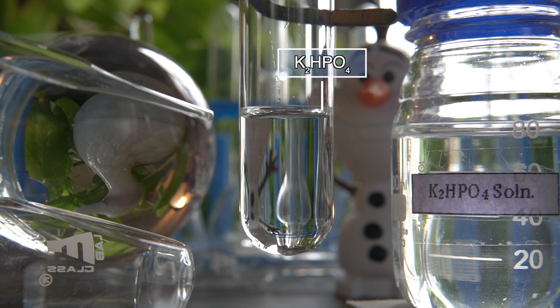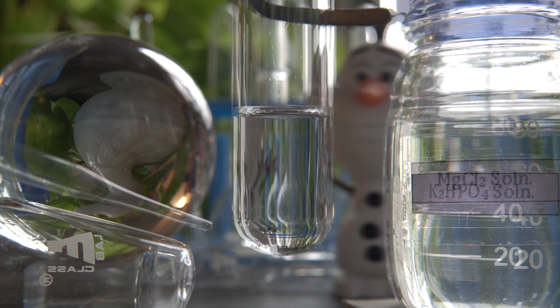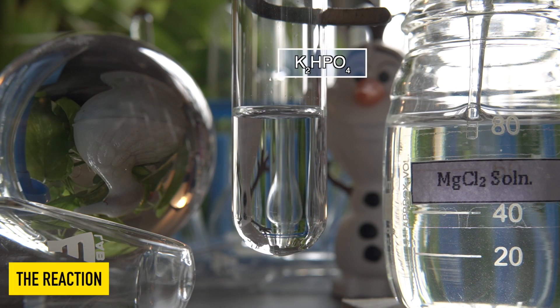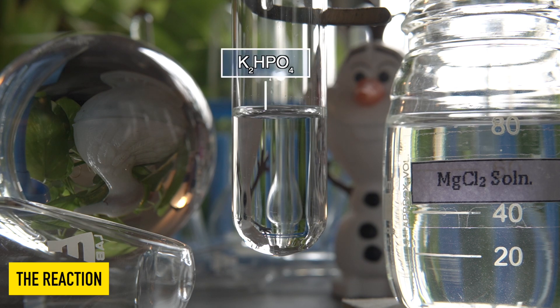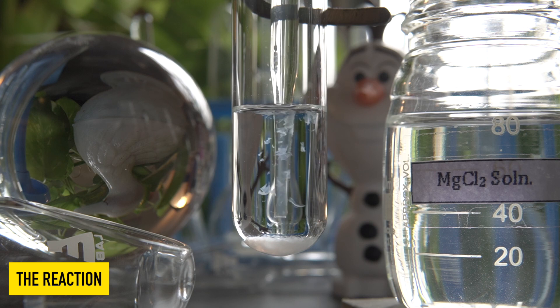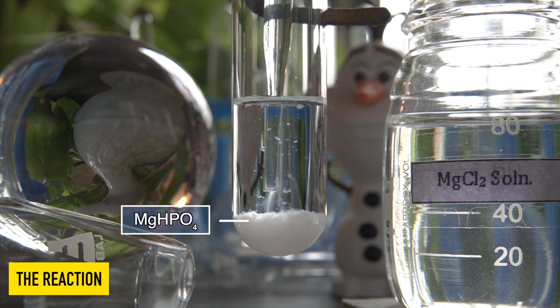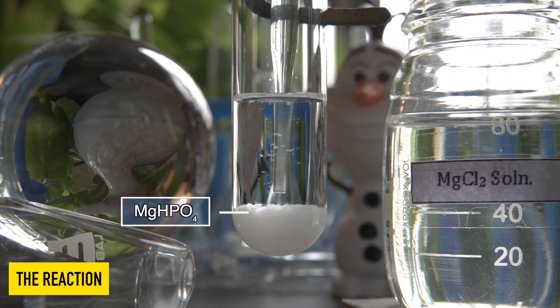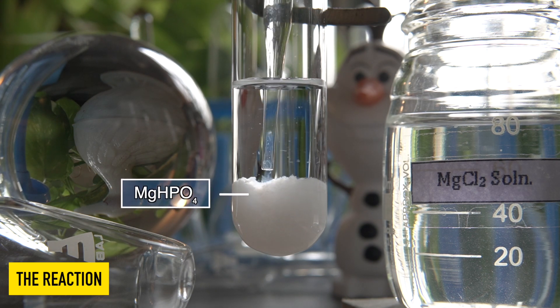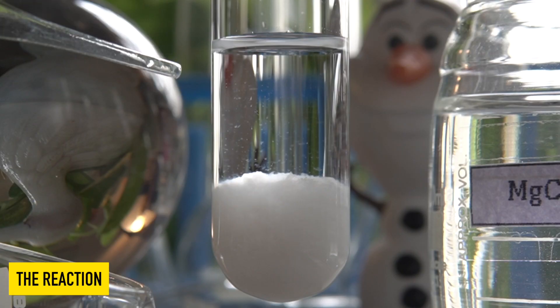To initiate the chemical reaction, we will take some amount of potassium phosphate into this test tube, then slowly add magnesium chloride solution into the potassium phosphate solution and observe the effects. A white precipitate has formed at the bottom of the test tube.